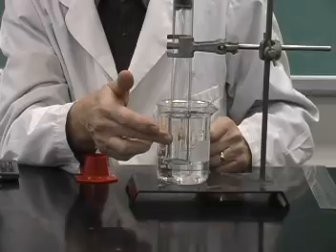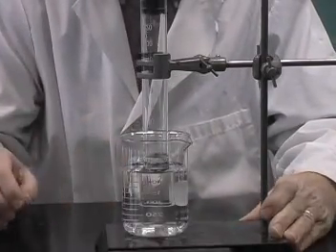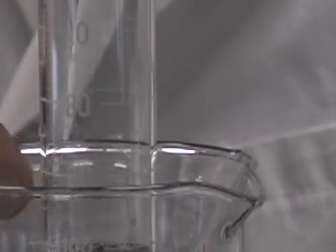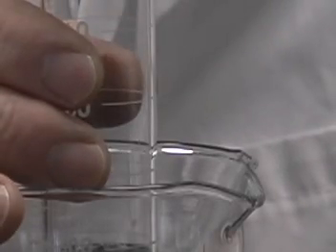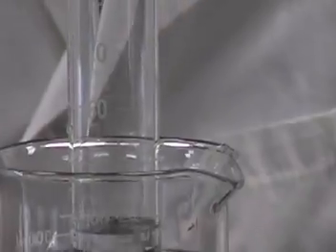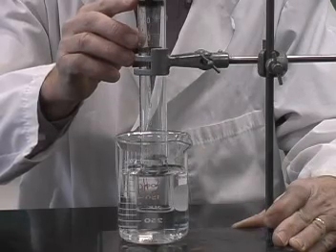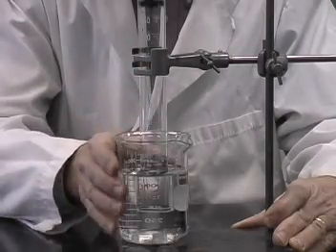used up. After standing overnight, the water level has moved up in the cylinder. You can see the new water level right here. What has happened is that the oxygen that's in here has reacted with the steel wool up in the top, and that has formed solid iron oxide, and as a result the volume inside here is decreased, drawing the water up.